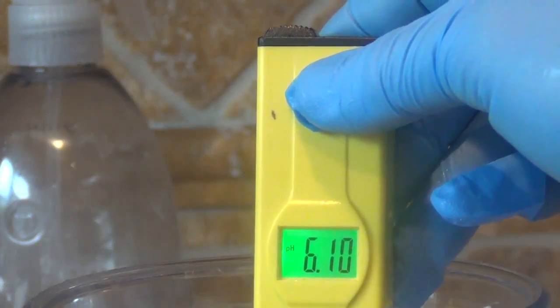Now that's nowhere near 6.86 so I have to get the screwdriver that comes with this on the back. This is a little bit difficult. It's hard to do this and do the camera at the same time.